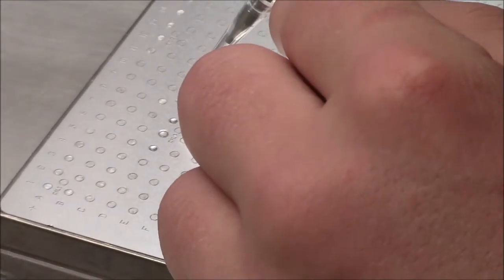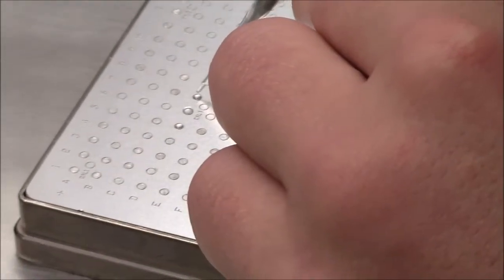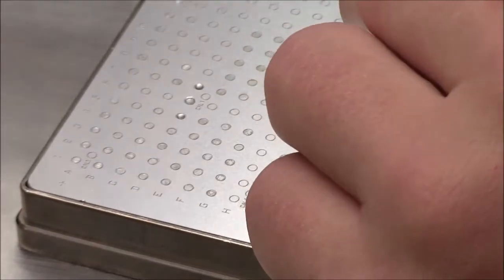And there's a grid. So you have to be sure you know where you are in the grid. It looks pretty. And you're adding the sample with proteins in it.